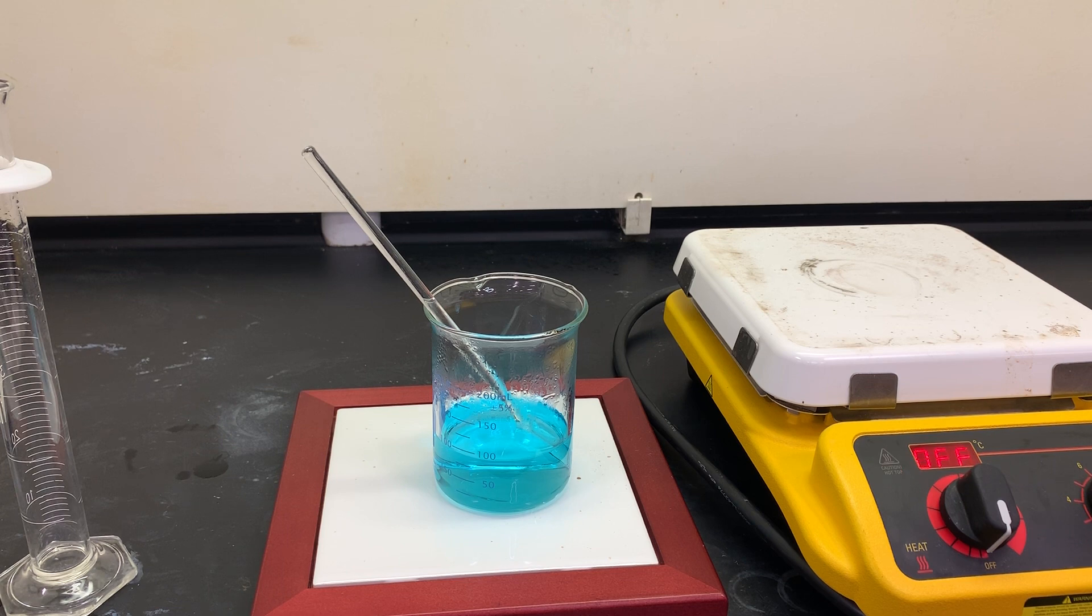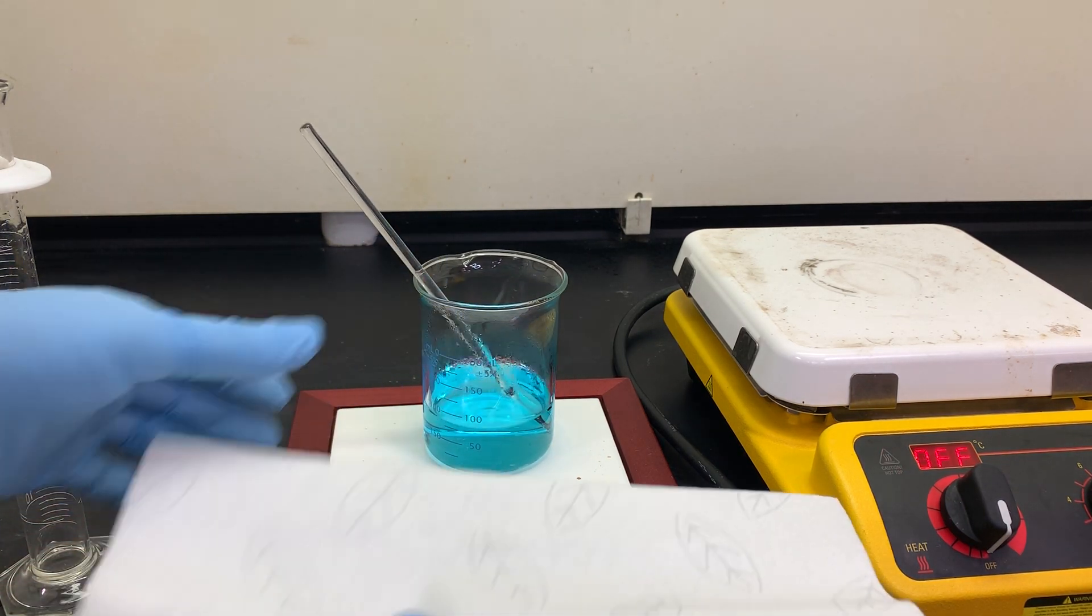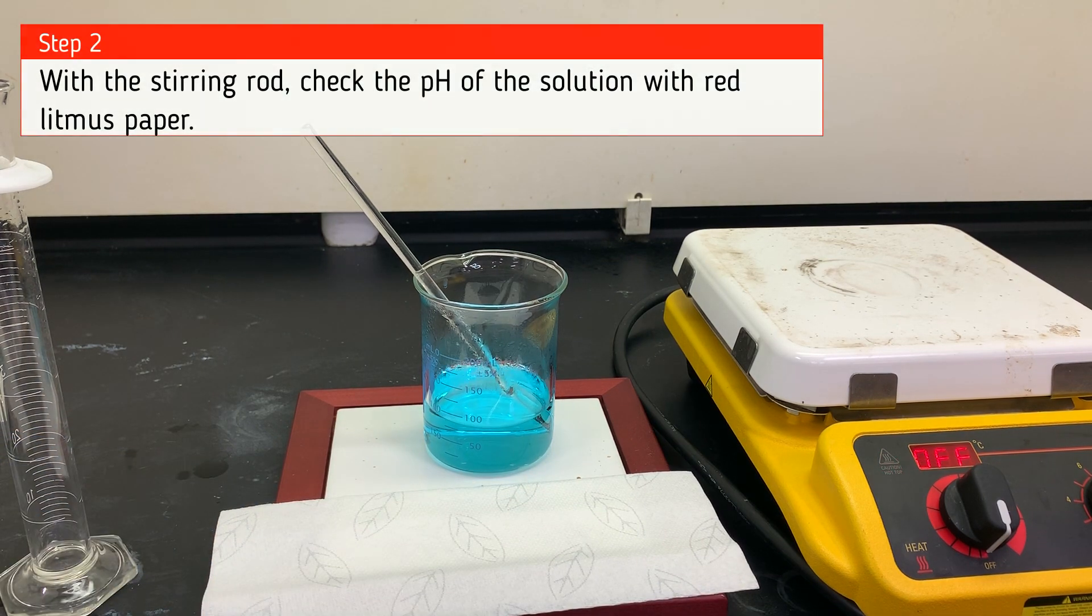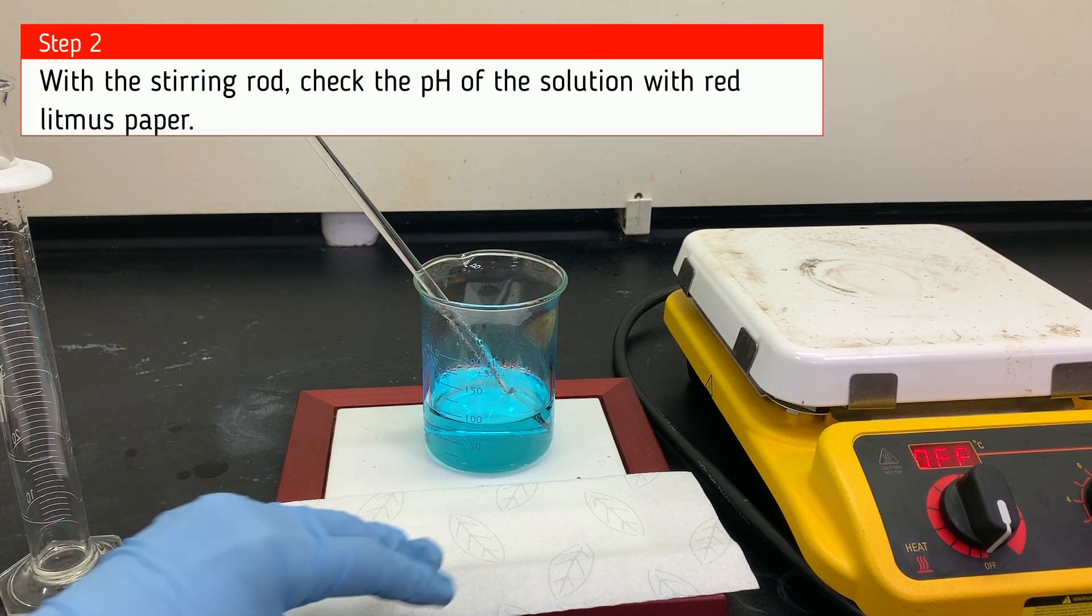Now our goal here is to completely get this to react and to make sure it's neutral. So what we're going to do is set up some litmus paper tests and check the pH.